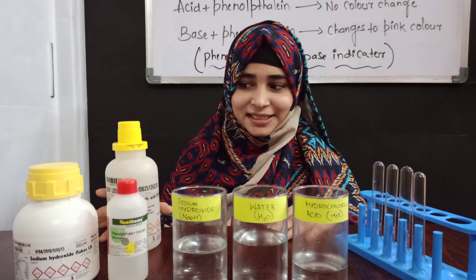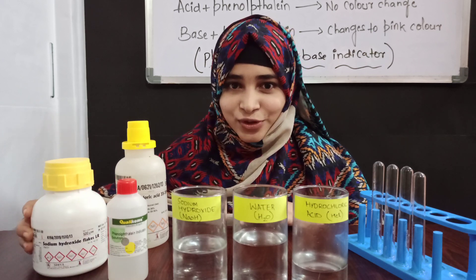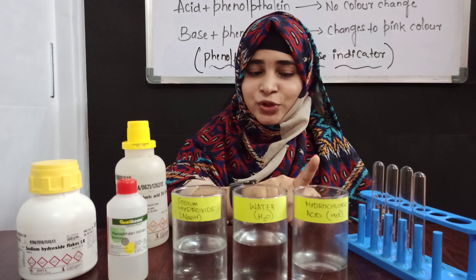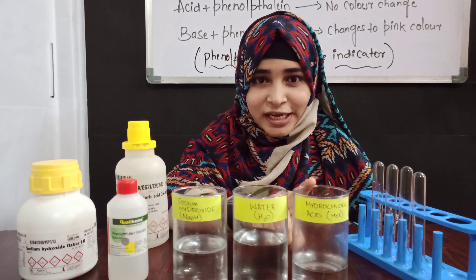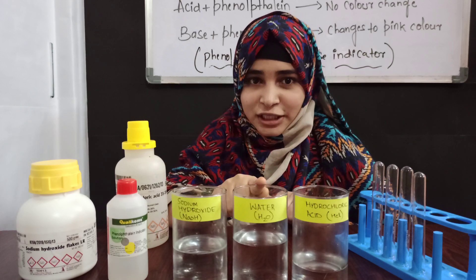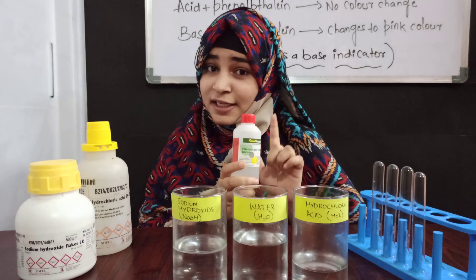Here I have concentrated hydrochloric acid HCl solution, base as sodium hydroxide, and the base indicator phenolphthalein solution. The first beaker consists of dilute hydrochloric acid — I mixed the acid into water to make it dilute. The second beaker consists of water, and the third beaker consists of the base, sodium hydroxide.